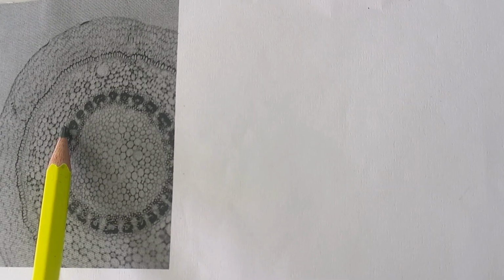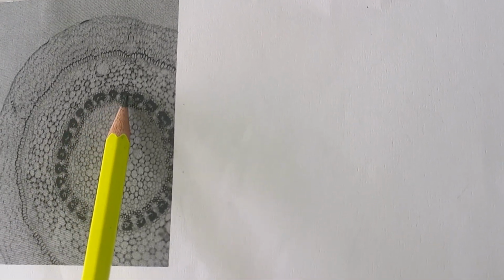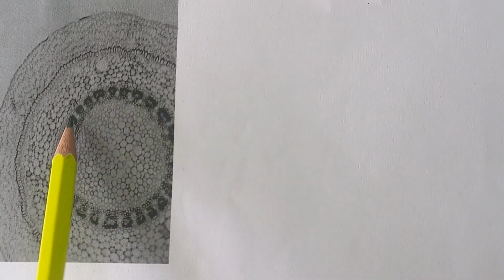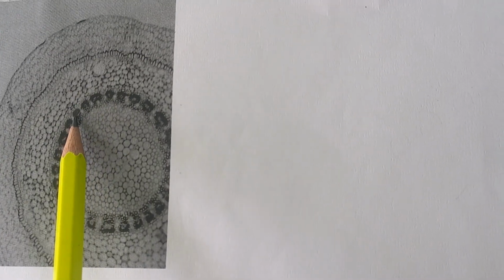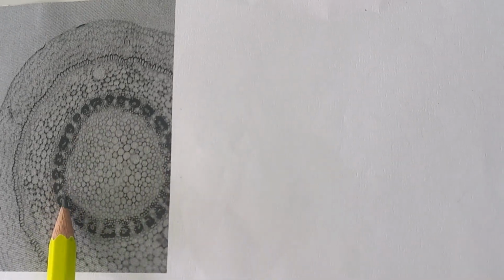So we'll give this another tissue. This and this and these are xylem. All right, so we'll give them a tissue, and here is the phloem. Look at this area of the xylem, thickenings like this, and then the pith. These are the tissues we are going to put in.